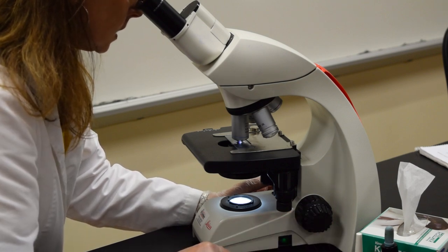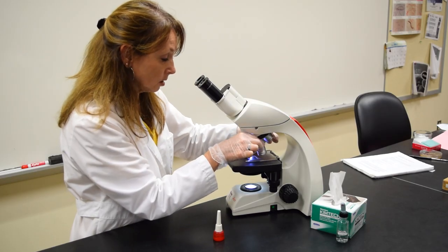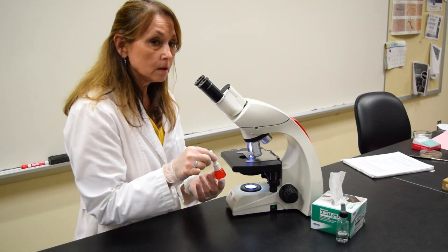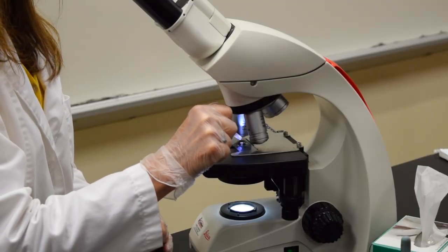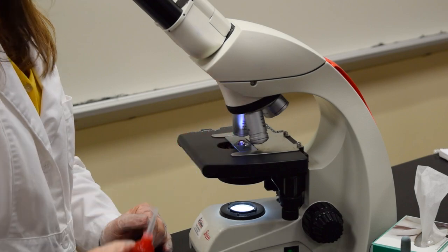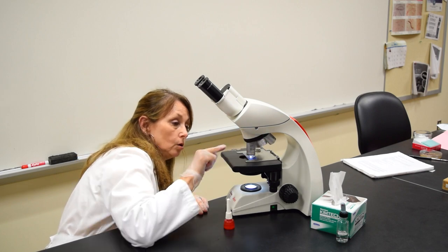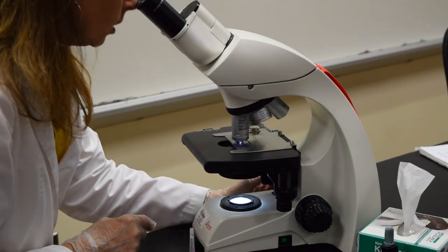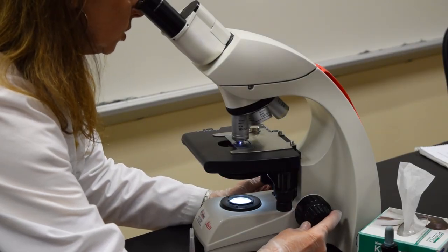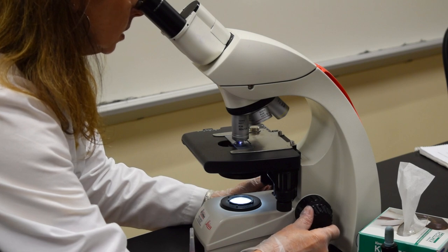I'm now ready to look at this stained slide using the oil immersion lens, which has a total magnification of 1000x. I'm going to move the high power lens a little out of place, take my container of oil, and put a drop of oil on the slide. I then move the oil immersion lens in place, making sure that it is touching the oil. I look through the eyepiece using my fine adjustment knob and adjust so that I can see the cells clearly.